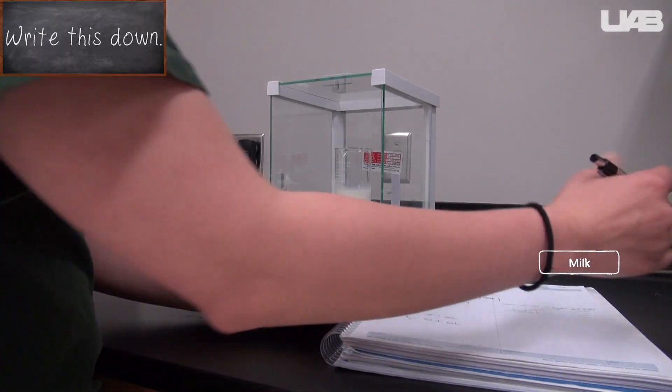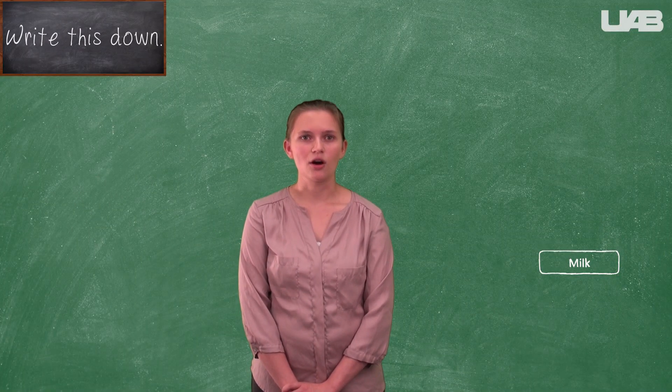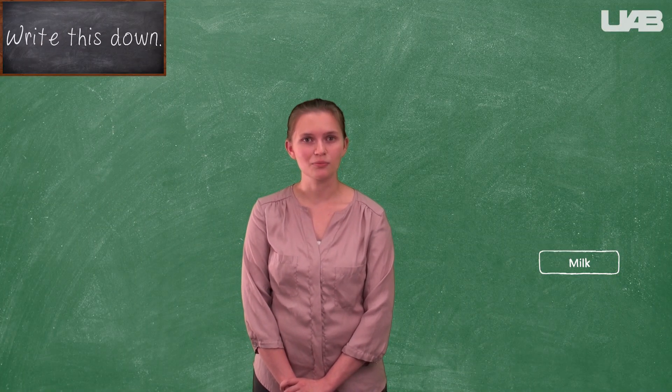Don't stress out about it being exactly 50 milliliters, just aim for roughly 50. You will complete all exercises in this lab with this one sample of milk.